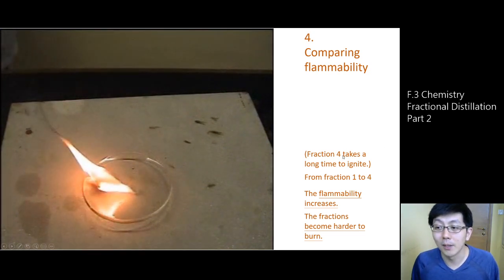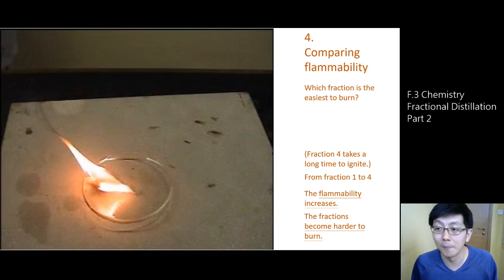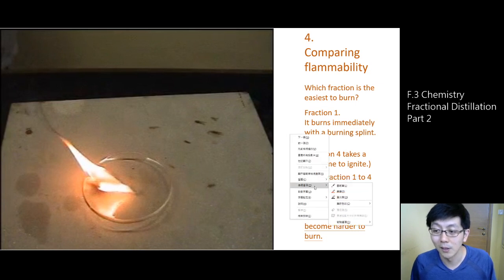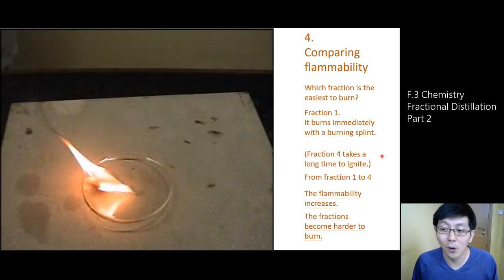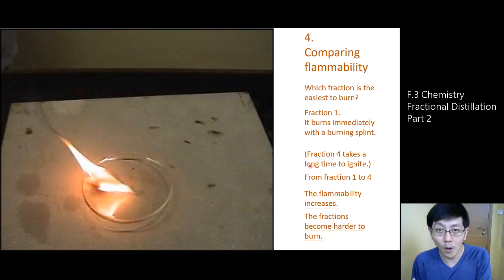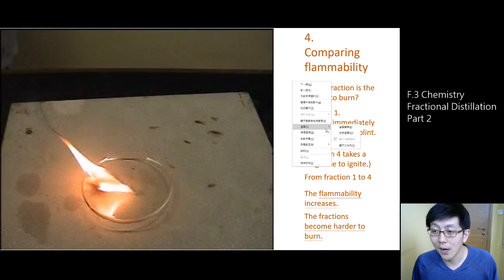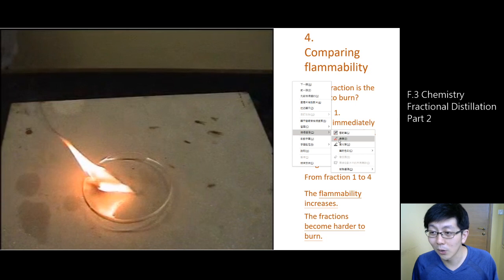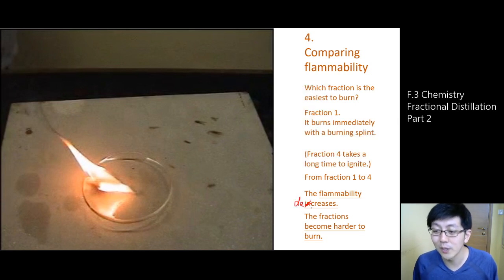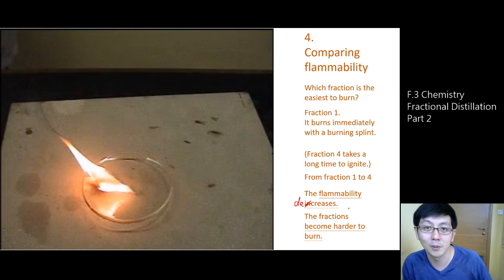If we compare flammability, fraction 1 is obviously the easiest to burn — it burns immediately with a burning splint. Fraction 4 takes a long time to ignite. From fraction 1 to fraction 4, the flammability decreases — the fraction becomes harder to burn.